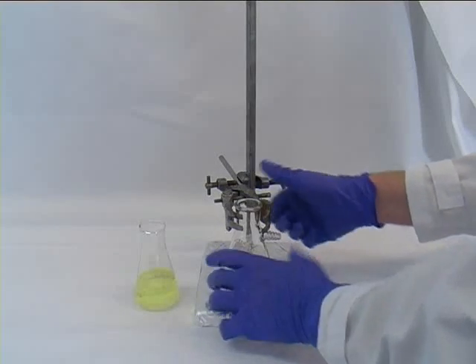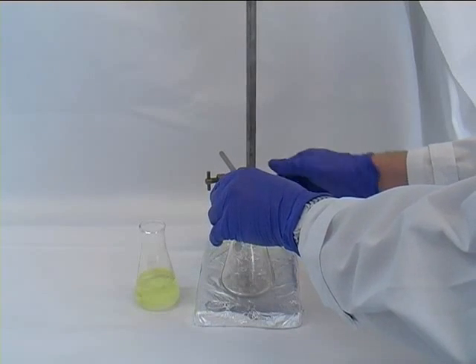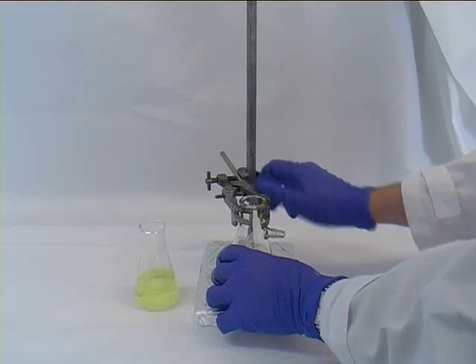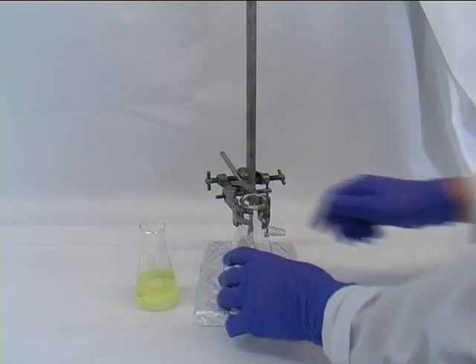There are two ways you can do this. One option would be to do it under vacuum filtration, the other one to do it under atmospheric pressure.